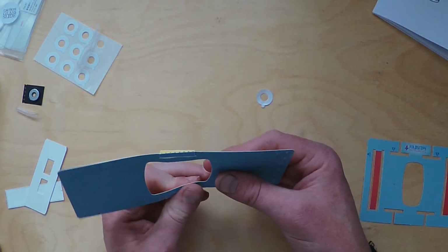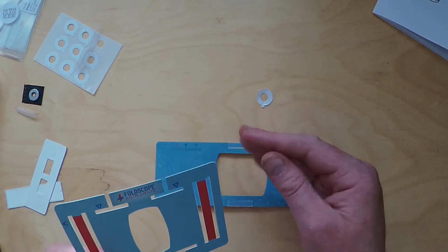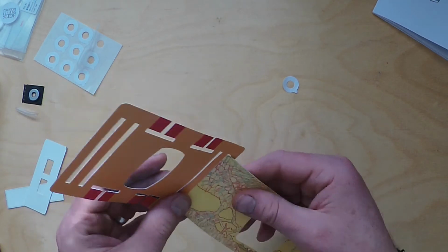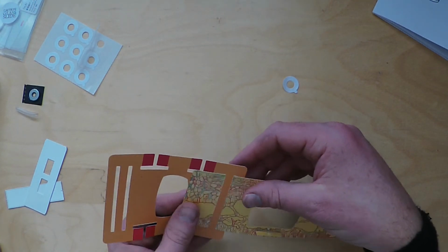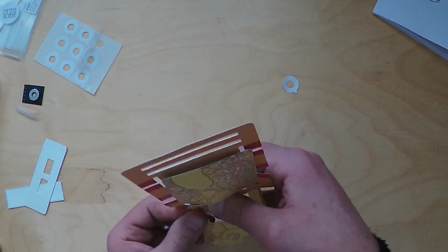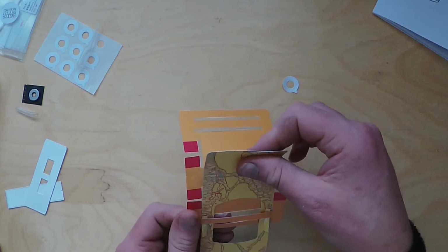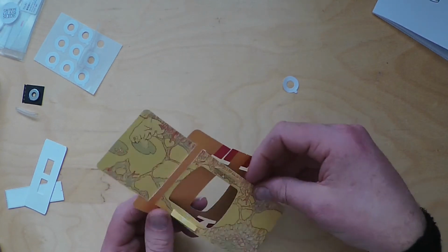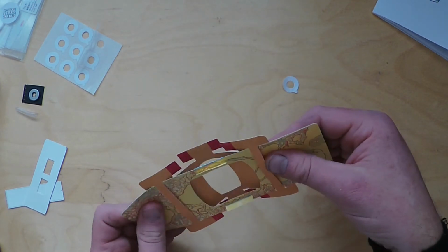Now you need to put this sample stage into the panning guide, as it's actually called. So flip it over to the yellow side. You want to slot it in, feed it through those slots there, so you get that effect. You can see that in the instructions as well. That slides through there. Guide it through those newly folded yellow tabs. That takes a bit of guidance. You should end up with that.